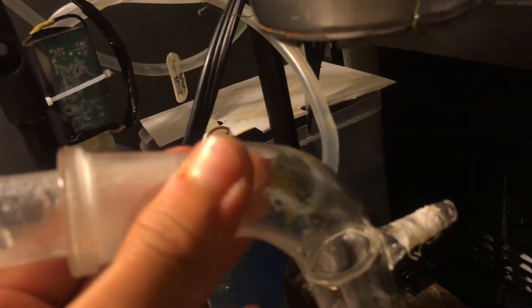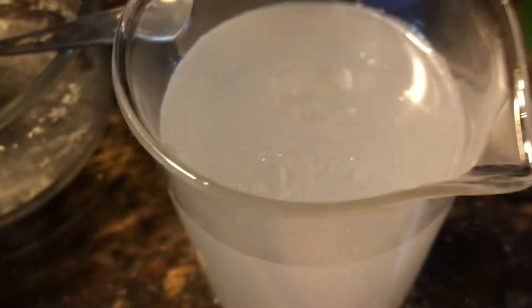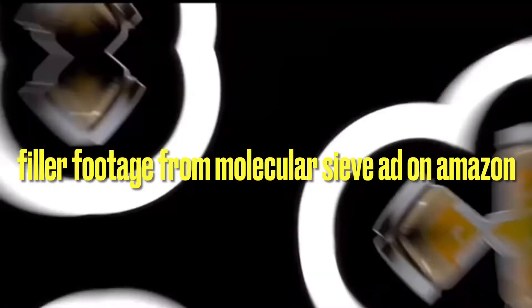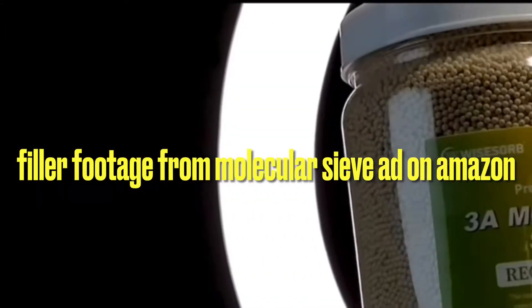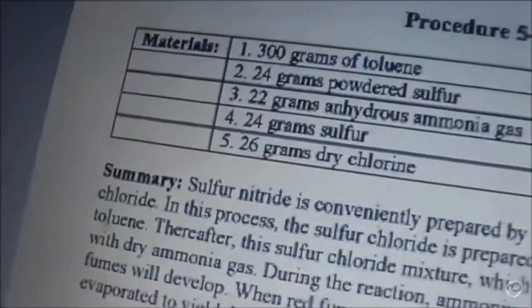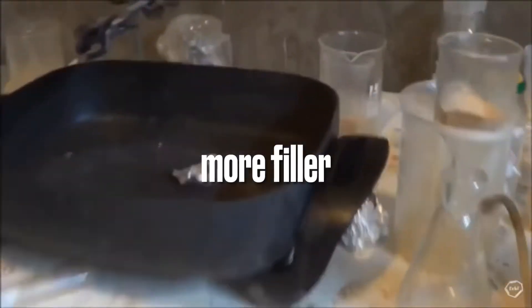I added an adapter on the end to help condense more of the steam, and set the hot plate to about 100 degrees to keep the solution hot so less water condenses back in. Ideally, you'd run the steam through coarser cinnamon powder. The cinnamaldehyde yield here isn't a huge improvement over version one, but it might be worthwhile depending on your application. If you just want cinnamaldehyde, you could buy it — making it from scratch involves benzaldehyde and is quite a pain. Anyway, that was the video — see ya.